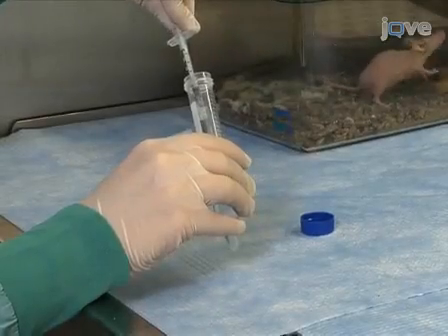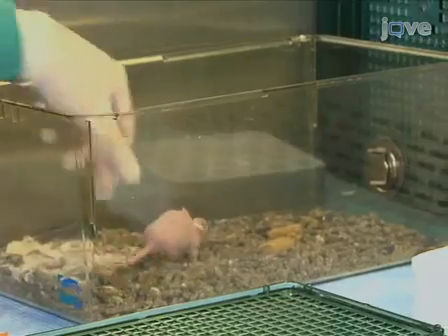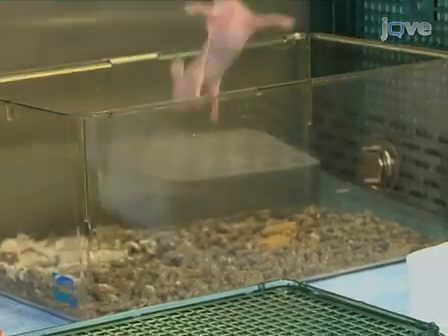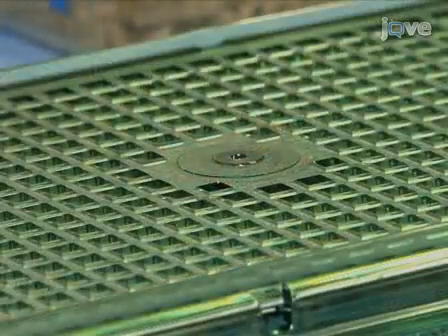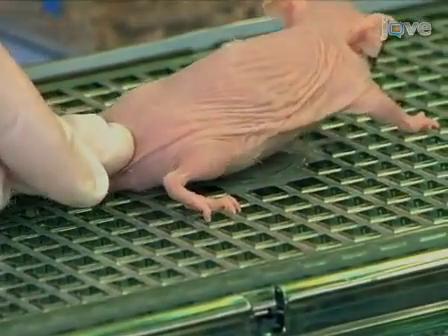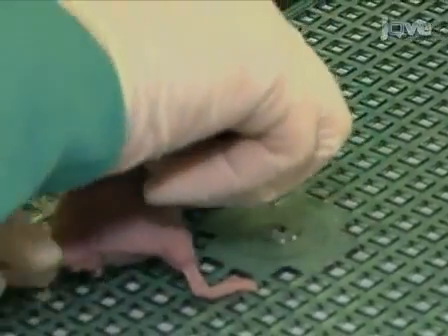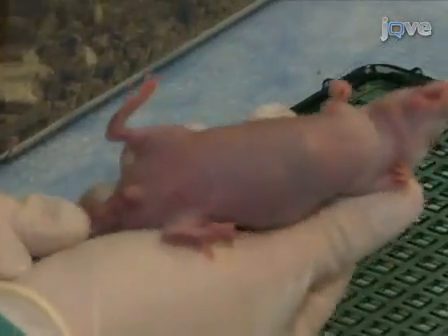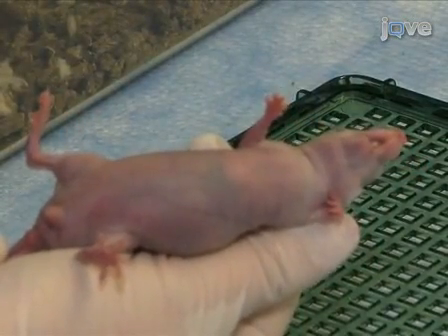Prepare for this procedure by loading a syringe with a 28-gauge needle with the drug. Remove the mouse from its cage by the tail and place it onto a textured surface, such as a cage lid, so that the mouse has something to grip. Allow the mouse to stretch its body. Next, grasp the skin on the back of the mouse, taking care to lightly pinch as much skin as possible between the thumb and index and middle fingers.